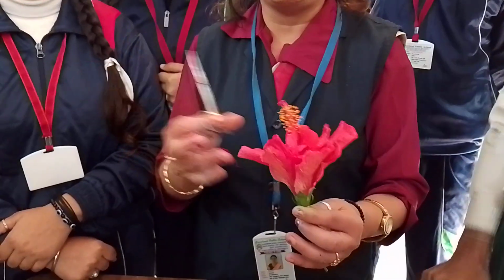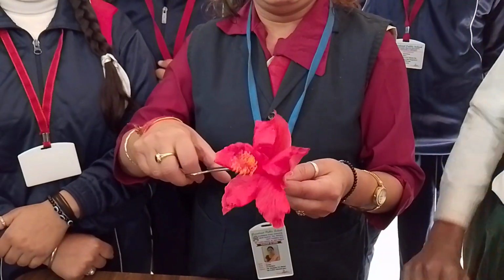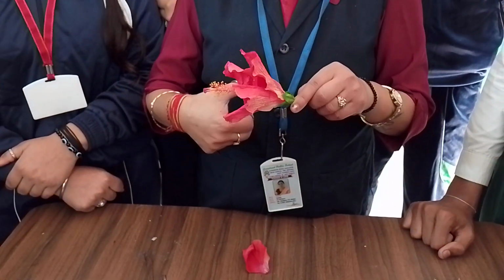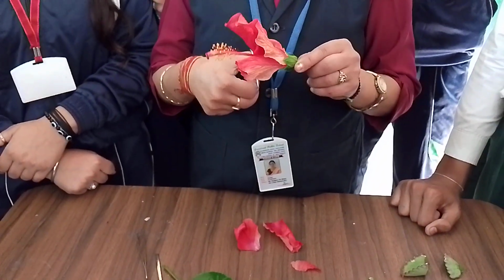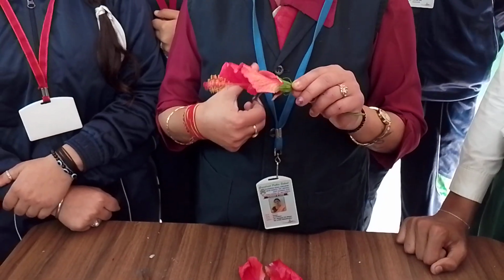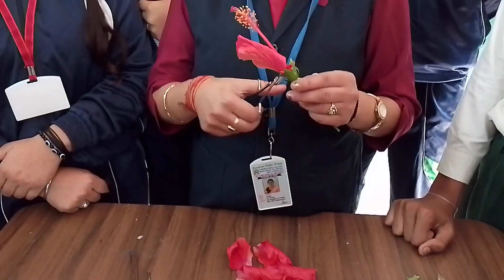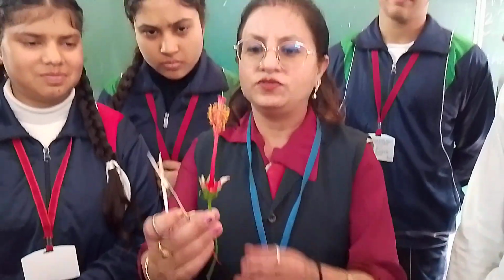Yes. These are petals. So counted 1, 2, 3, 4, 5. 5 are there. Yes. 1. Let me check. 2. This is your third one. This is your fourth. And this is your fifth one. 5 are there. Yes. Now what you have seen.